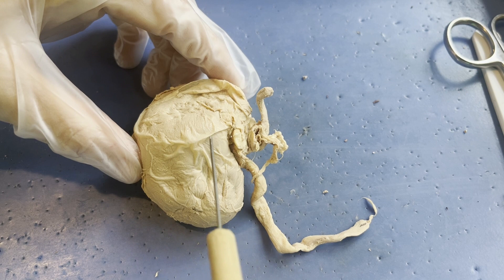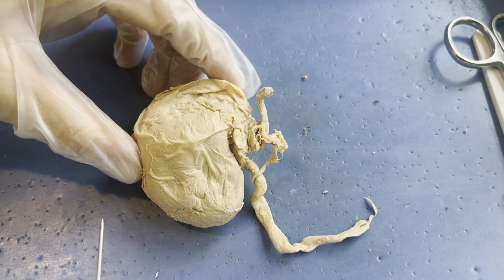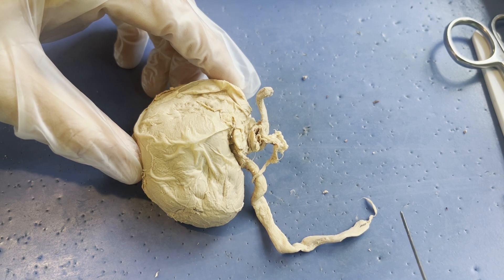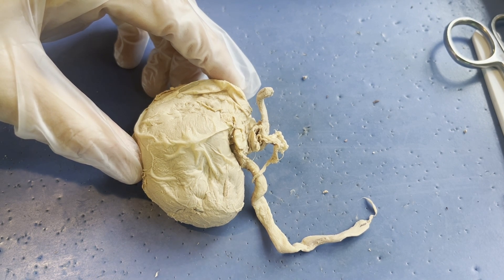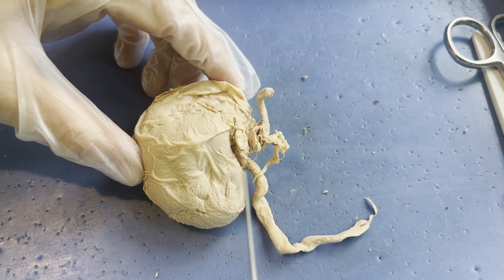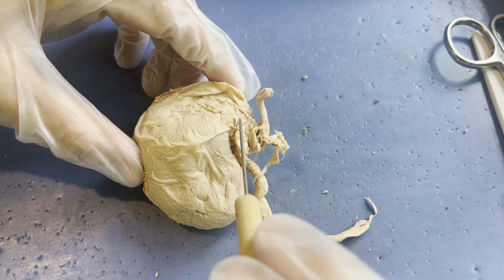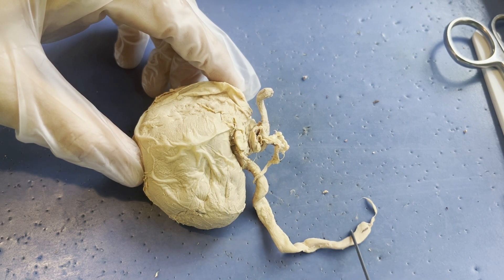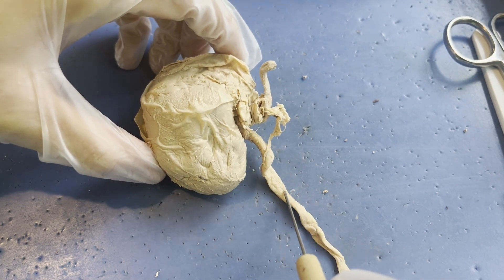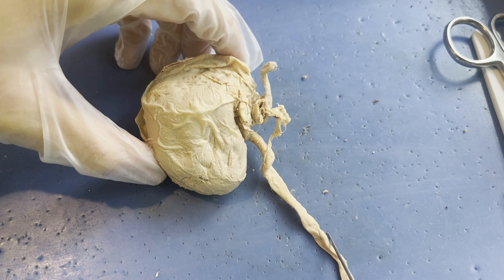The kidney filters out all of those impurities. That extra water, urea, salts, and anything else that our body doesn't need any longer forms a substance that you're very familiar with — that's what our pee is made out of. So the kidney collects all of this waste, and that pee then trickles down this narrow, lighter tube right here known as your ureter.